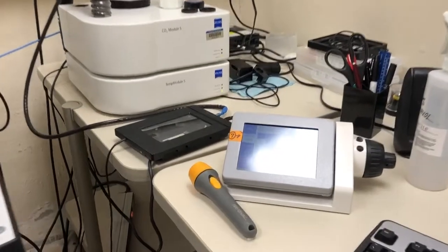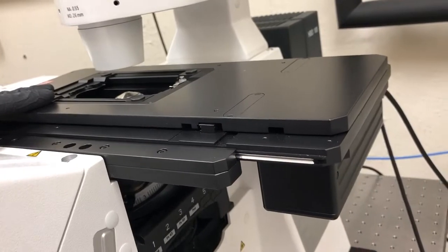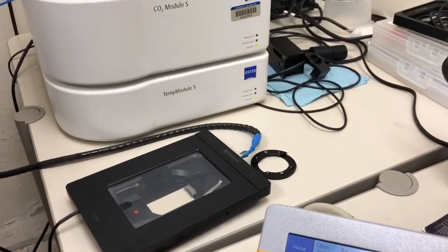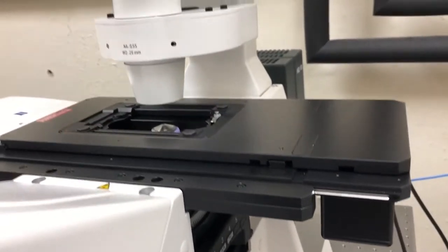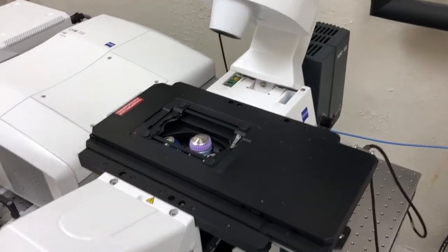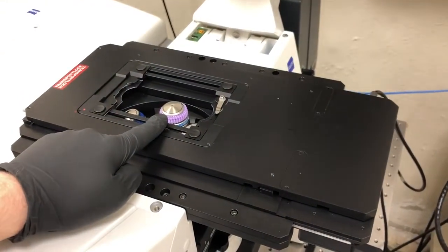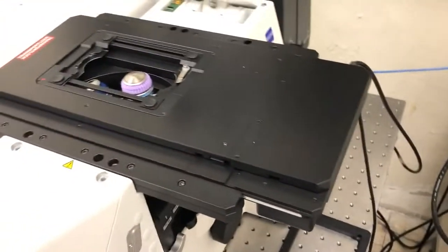So now that everything is on, let's discuss how to place the incubation chamber on the stage of the microscope, as well as later how to place a sample inside the incubation chamber. To be able to do this, first thing we need to do is push this arm back to give us some room. And then we definitely don't want an expensive oil objective, this is the 40X, in position when we're trying to put this heavy object on the stage. So instead, I'm going to switch to the 10X objective by clicking here.